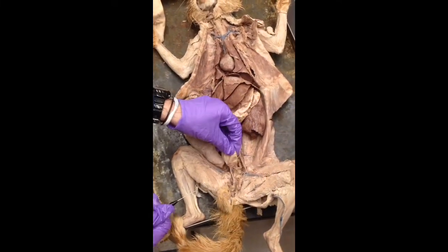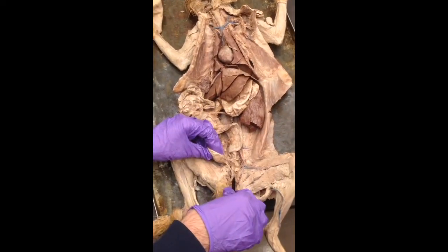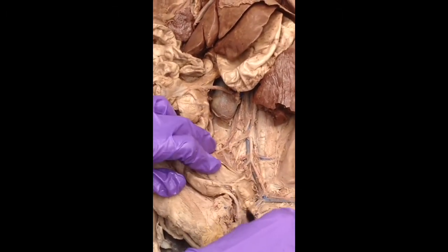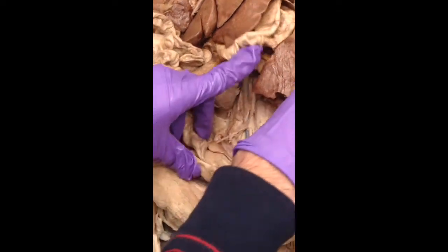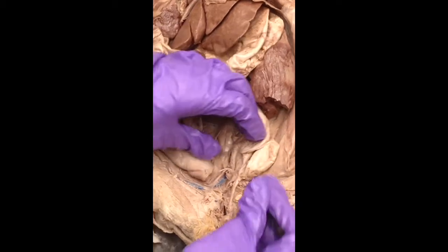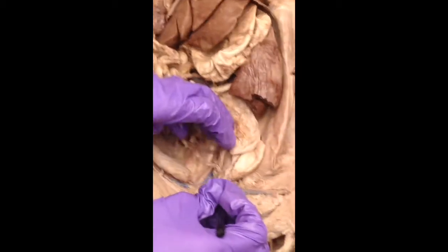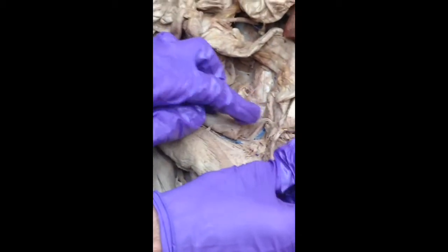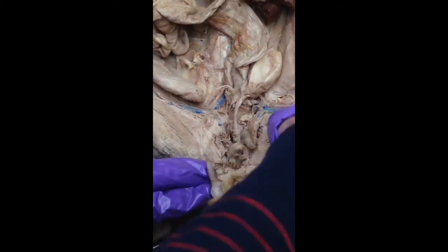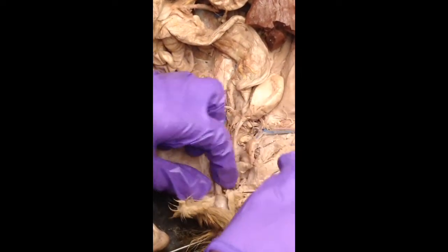All right, urinary bladder, right, little sac. These tubes coming off, those are the ureters. They should go up. If I hadn't completely destroyed them all, they would go up all the way to the kidneys. So expect a nicer dissection than this for those. This little bit here that I'm pulling on, that's the ductus deferens. They loop up over the ureters. So you're looking for a loop. If you're looking for the ductus deferens, this is a male. But they're going to loop up and come down and follow down this.